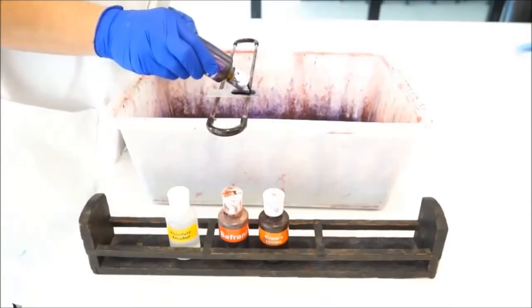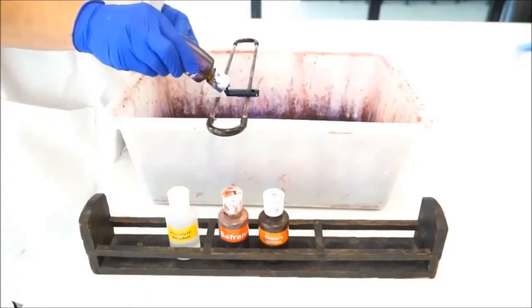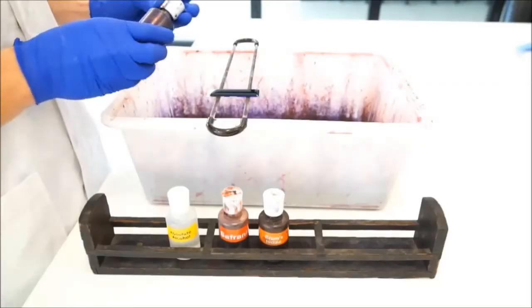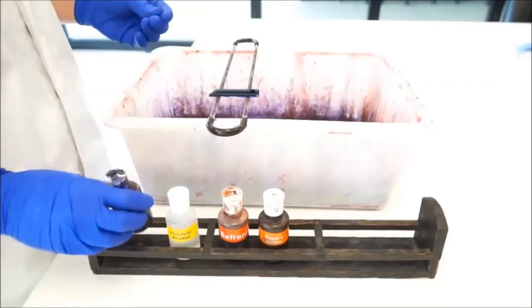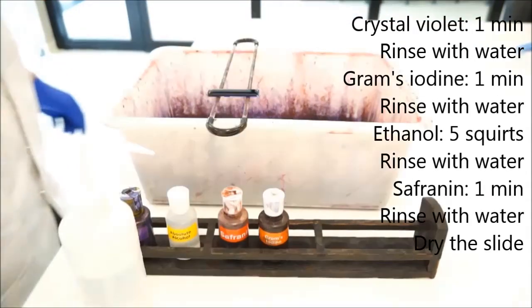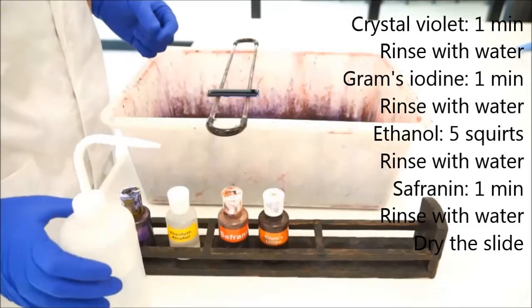Now you want to rinse right across there, and you'll know on your protocol that Crystal Violet has to go on for one minute, and so you'll leave it on for one minute. So let's just pretend that that's been on there for a minute.